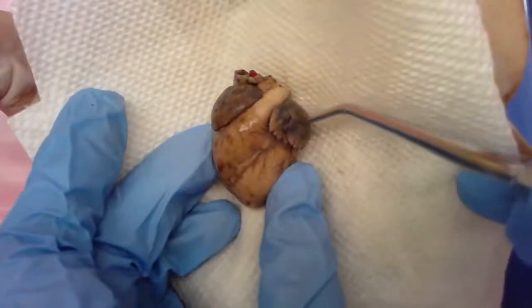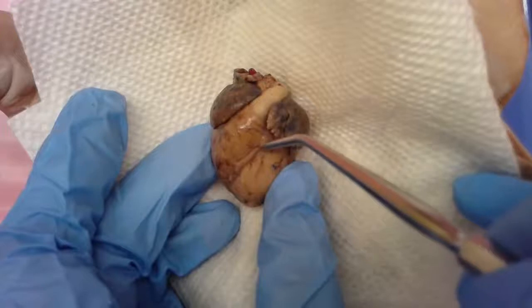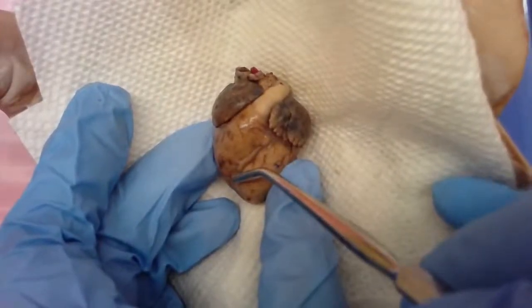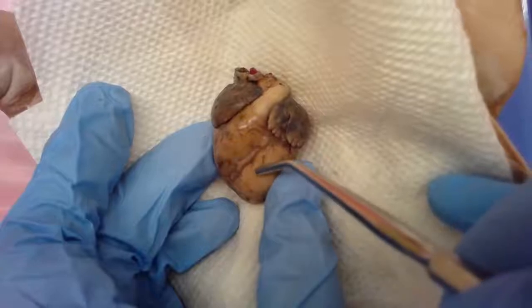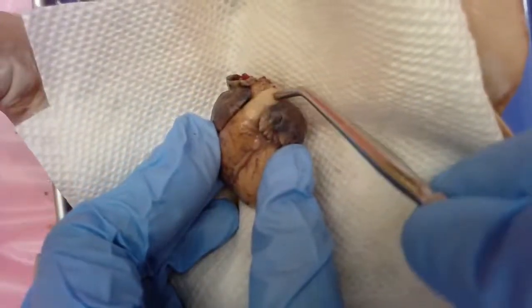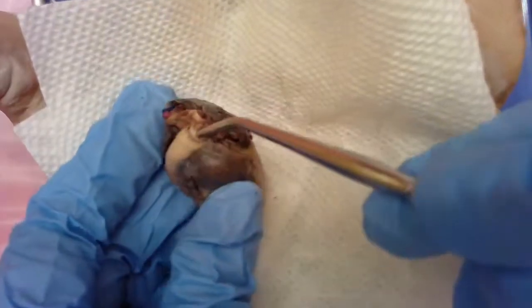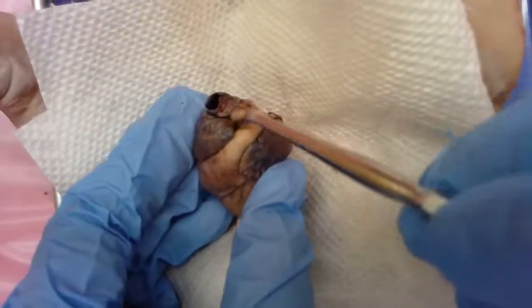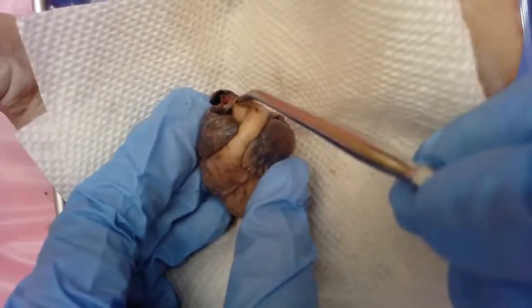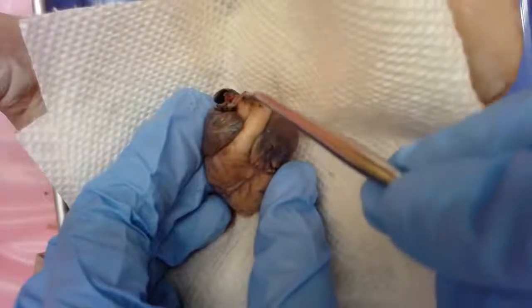We're pretending this was the way it was oriented in the pig. So this is our right atrium, here's our left atrium, right ventricle, left ventricle, and coronary arteries and veins running in that little groove on the surface that helps us divide those two ventricles. This big white blood vessel here is the pulmonary artery — that was the blood vessel that was going to the lungs. And going anterior on the heart is the aorta, which was the branch coming out of the left ventricle that was going to the body.